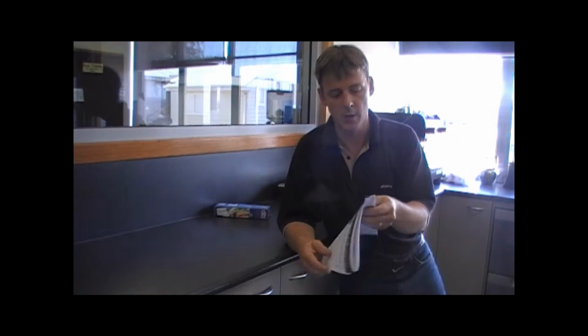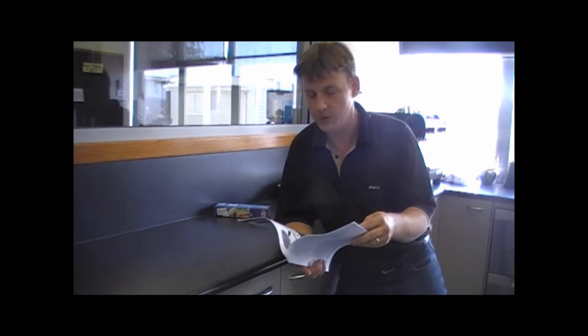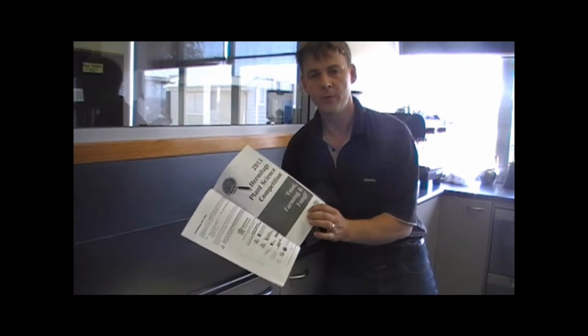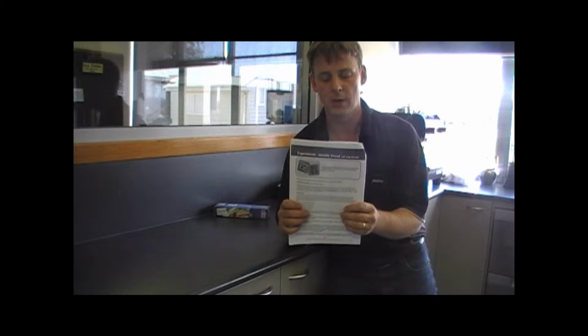Hey guys, the experiment that we're undertaking is for the Hermitage Plant Science Competition for 2013, and the focus this year is on food, farming and fungi. The first experiment that we need to undertake is the mouldy bread experiment.